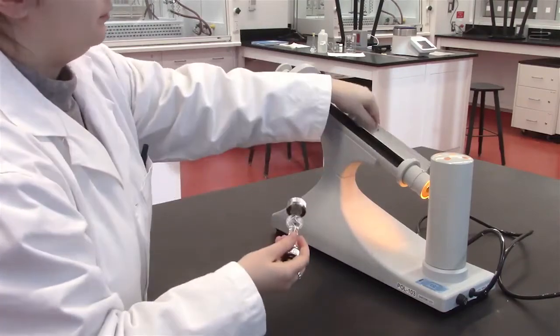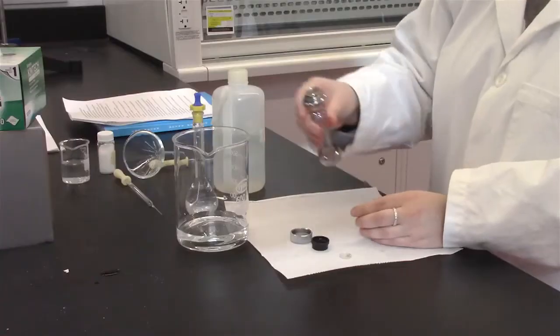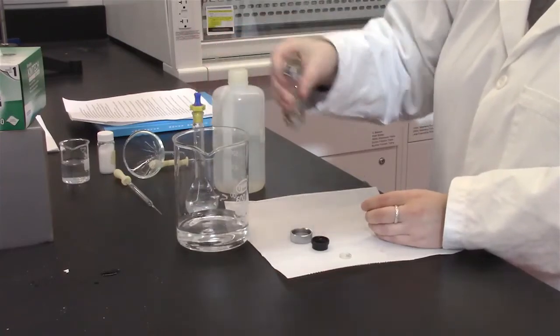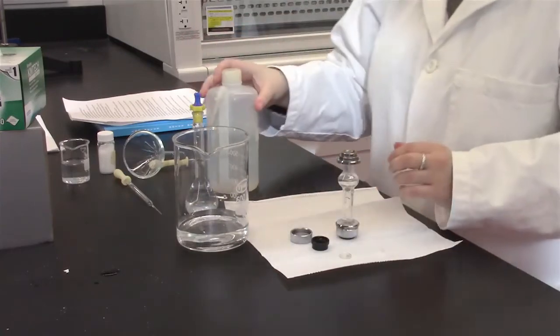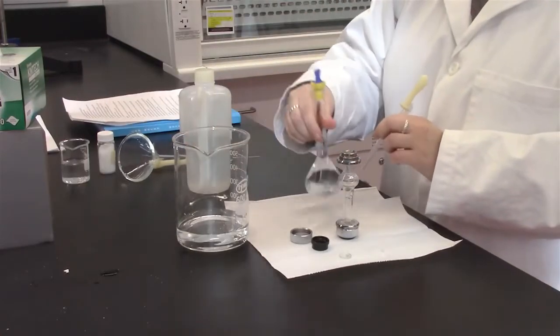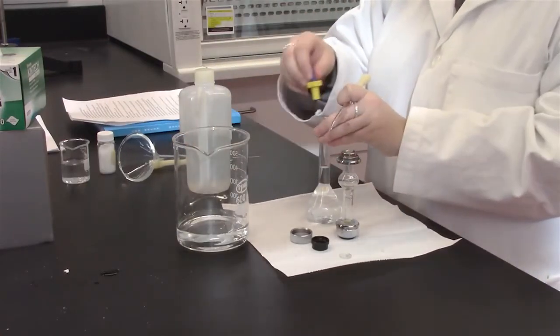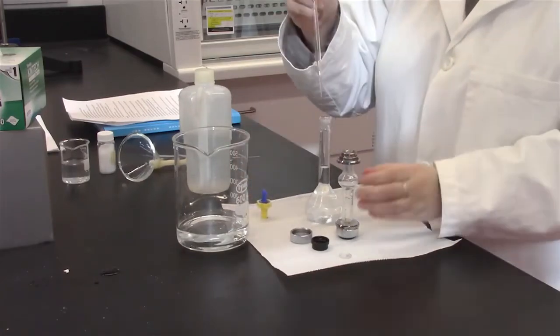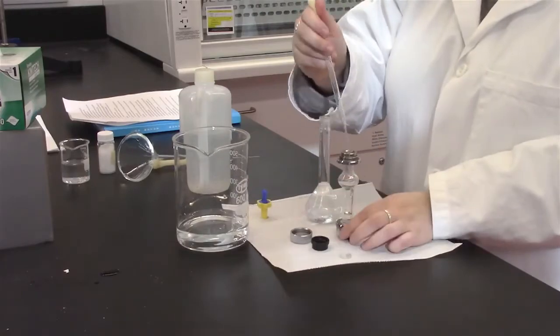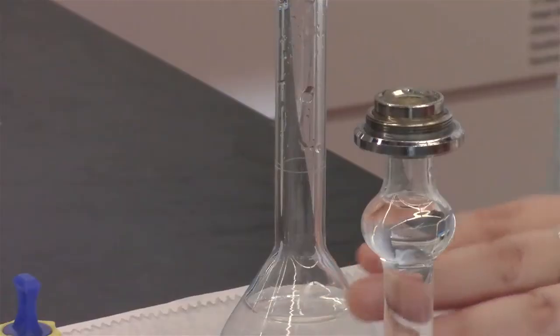Next, discard the deionized water in the waste beaker and fill the sample holder with your prepared solution. Ensure minimal bubbles are present or if they are present, they are present in the curved portion of the sample holder.